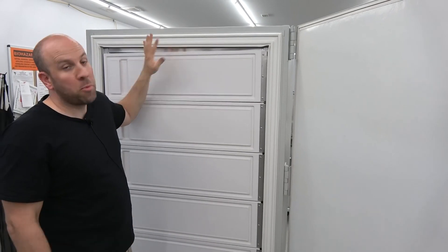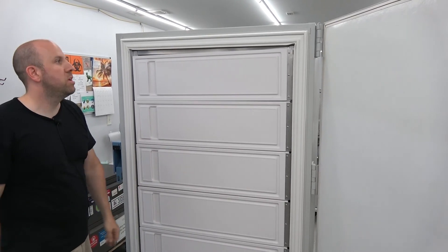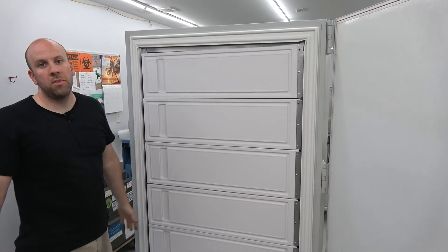It's a good do-it-yourself thing you can do — save yourself some money, it's not hard, and it will help your freezer run better, stay colder, be more efficient, and you won't have to worry about frosting and icing quite as much. Hope it helped.